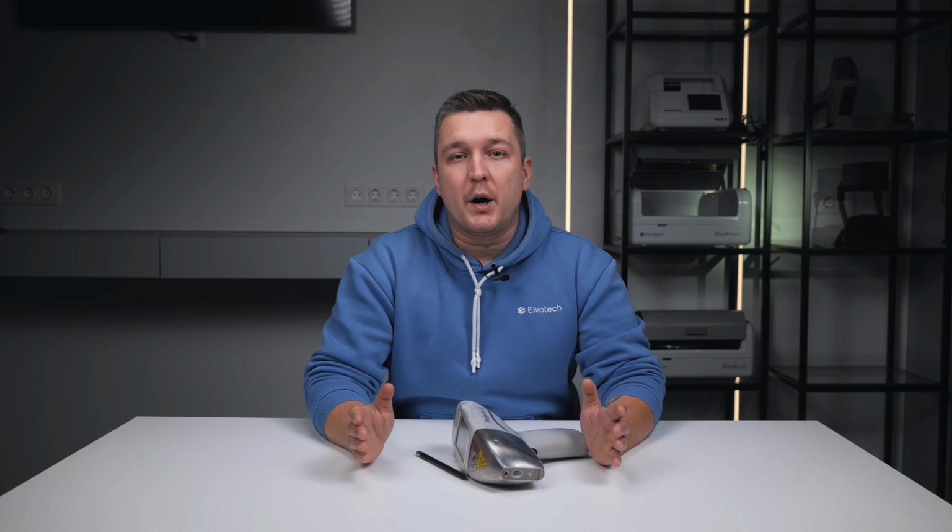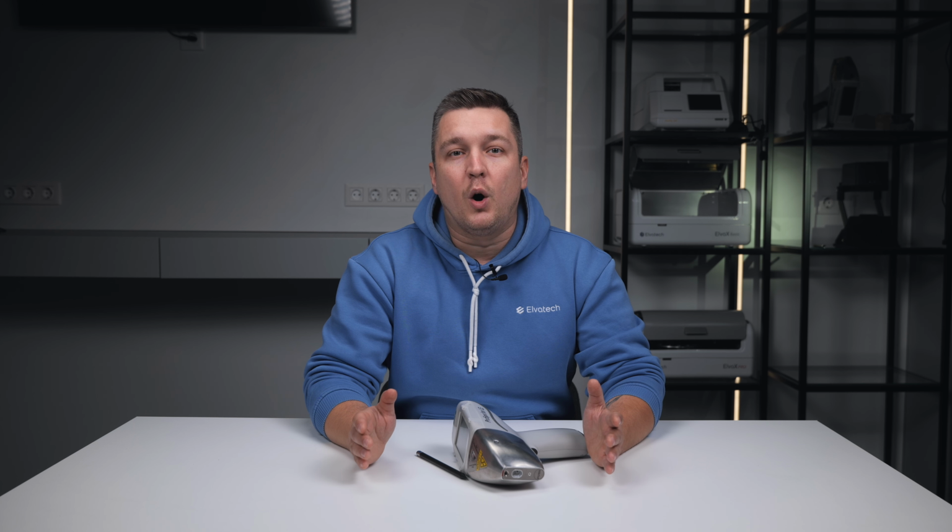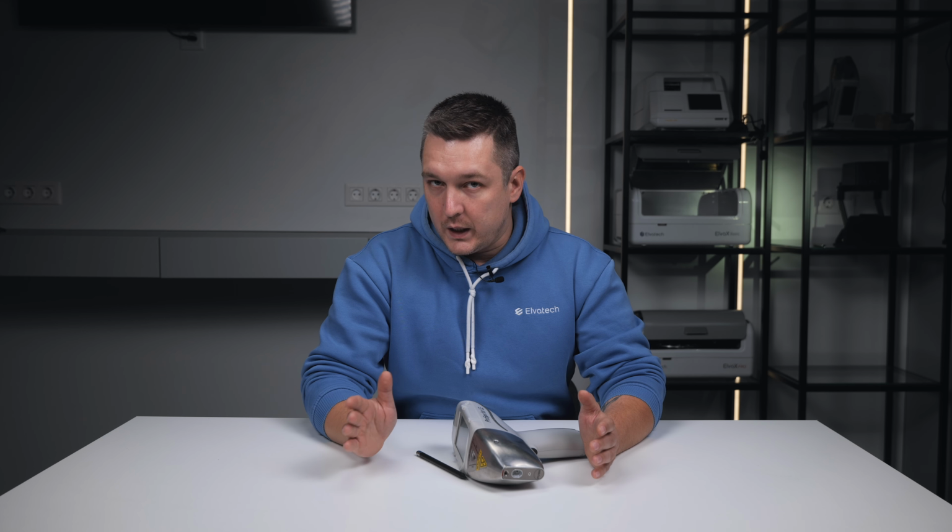Now you know how to use alloy grade and compare to alloy in ProSpector 2 on a deeper level. Alloy grade helps you quickly understand what you are dealing with, and compare to alloy mode lets you carefully verify compliance with the standard for every element. Together, these modes save you time, reduce sorting mistakes, and increase your confidence in the quality of the materials you work with.